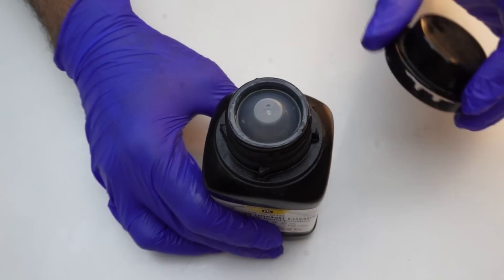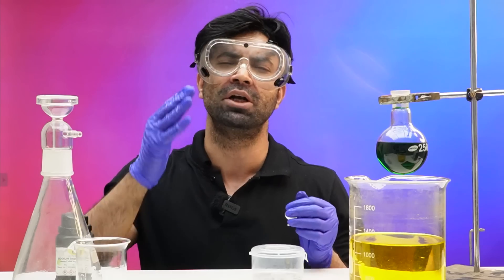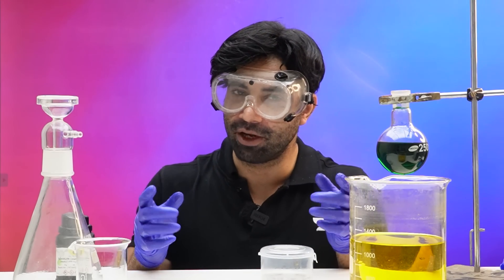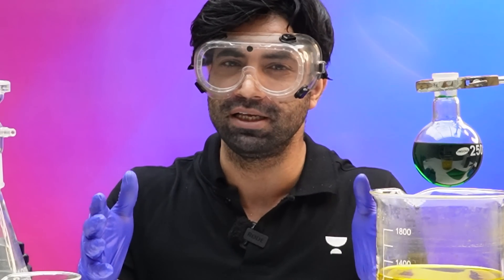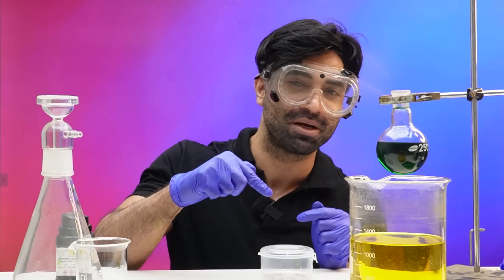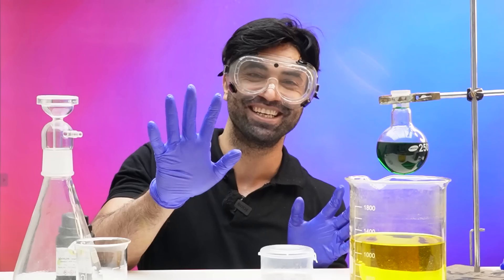There is a metal in your body which, if exposed to water near you, could literally kill you. In this video I would demonstrate what exactly happens, and by the end of this video you would know everything about what happens when sodium comes in contact with water — the reaction, the explosion, and your marks in JEE. Just kidding.